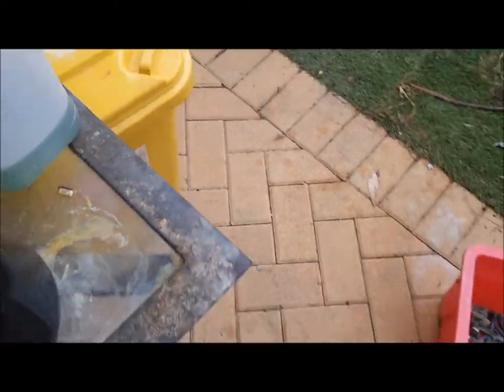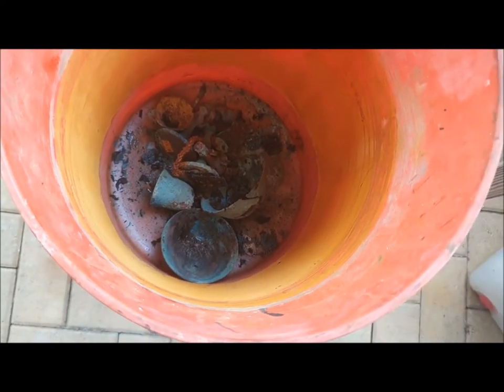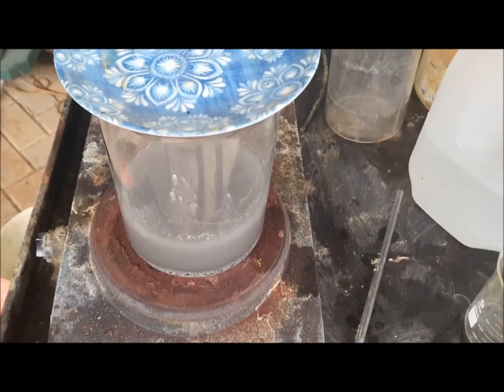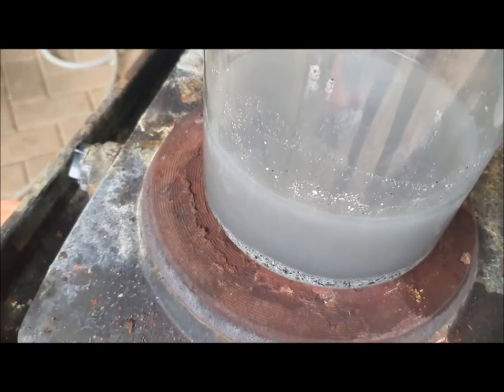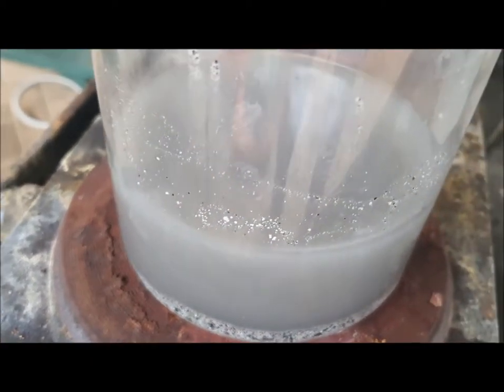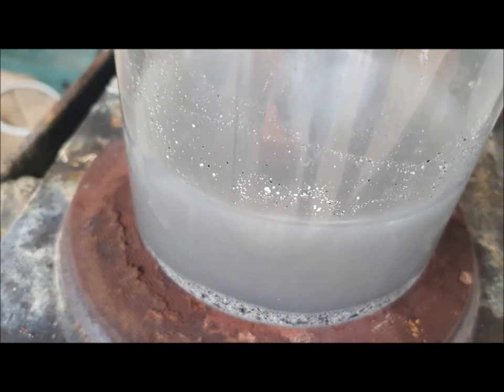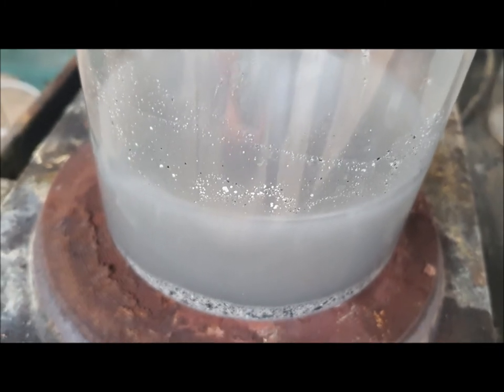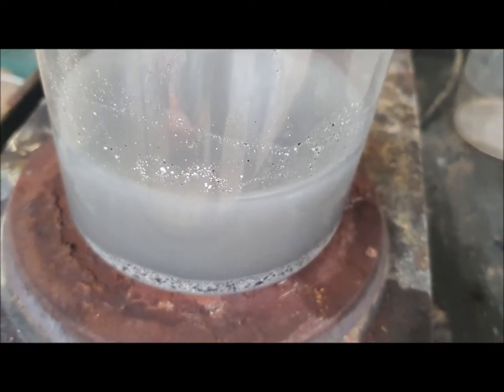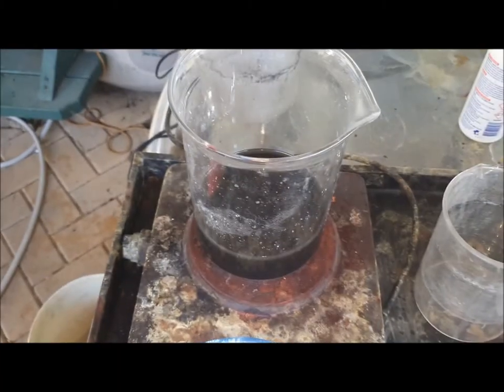I'm going to pour the free nitric acid out of that solution into here, filter it, and put all the liquid in. I've got the solution draining and I've also just started a new batch. What I did was rinse out the sediment with fresh distilled water to get all the remaining silver solution out of it, and then topped it up with more distilled water and some new nitric to see if I can get the last of any base metals out of the sediment.